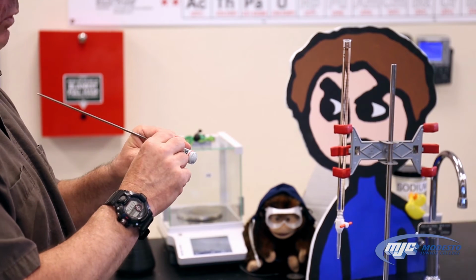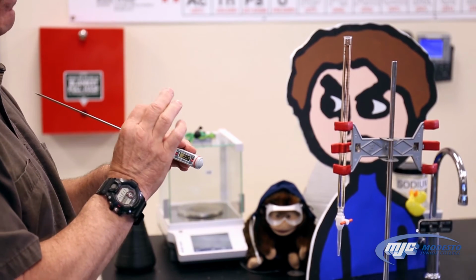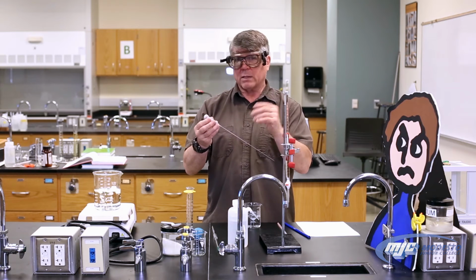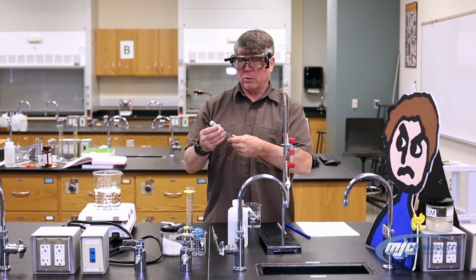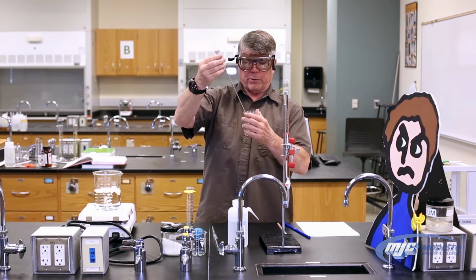Next, there's a switch that goes between degrees Fahrenheit and degrees Celsius. We always use degrees Celsius in here, so make sure it's on degrees Celsius. And with the digital thermometer, if you can, try to avoid touching the metal part when you're reading a temperature, because the heat from your hands could alter the temperature that it reads. So hold it on the plastic part up here.